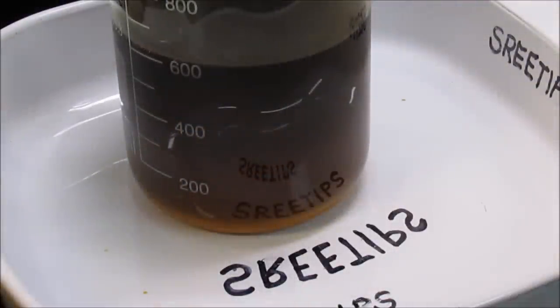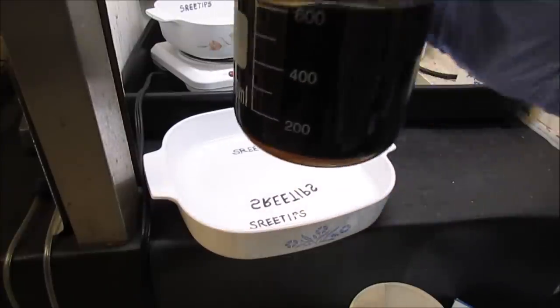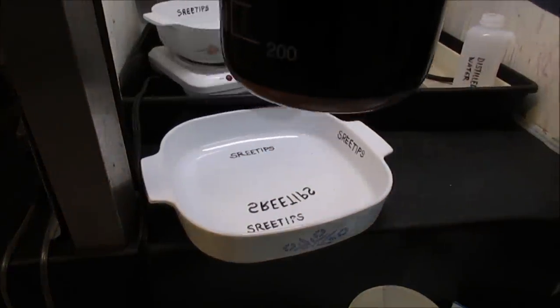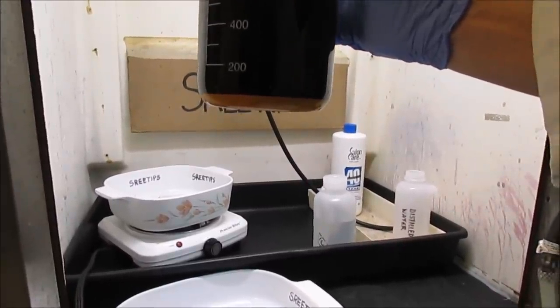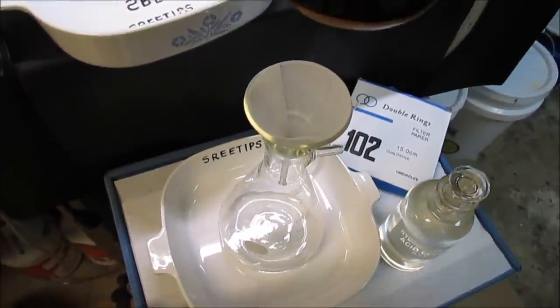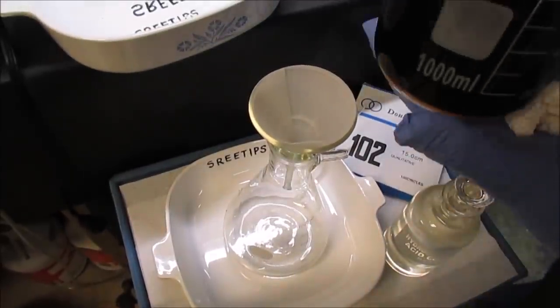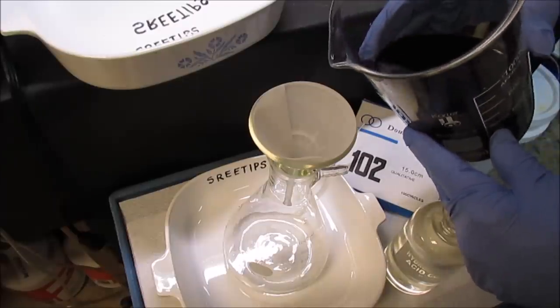This is about a four-minute segment of video sped up to eight times. When I added that ammonium chloride, two things happened: the platinum precipitated out and the palladium solution became infused with ammonium chloride for the next step. Our solution has been allowed to settle for about an hour. The ammonium hexachloroplatinate has settled out to the bottom. I've set up a little filter down here — what I'm going to do is filter out the solids, which is the platinum, and then proceed with recovering the palladium.